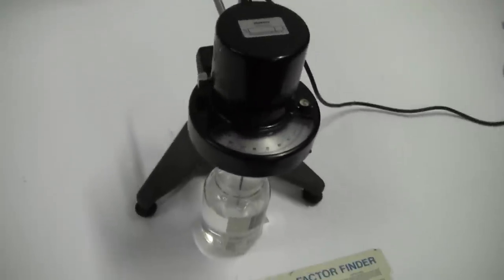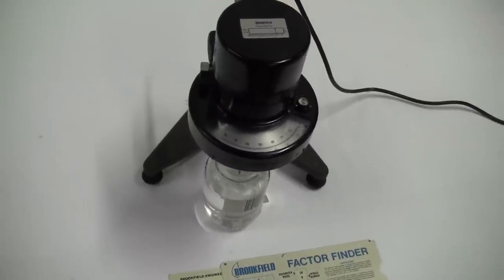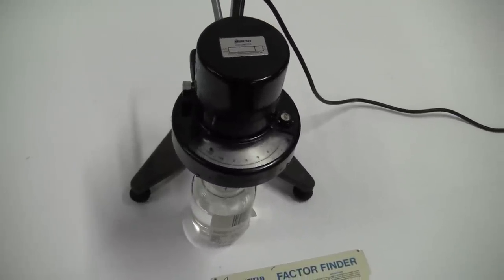We have it set up in a standard solution, 1500 centipoise standard. And here we go, we're running at 12 RPMs.